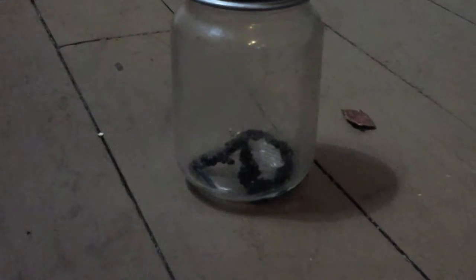What is up, guys? Damon Jackson here, Noob Destroyer 1, and these are my copper acetate crystals when they are done forming.